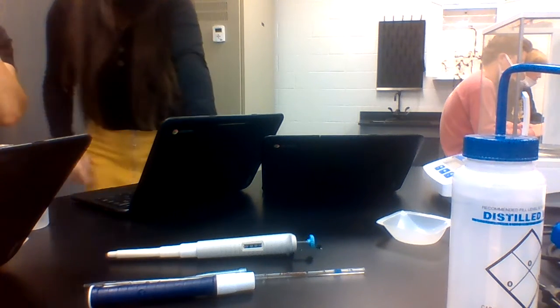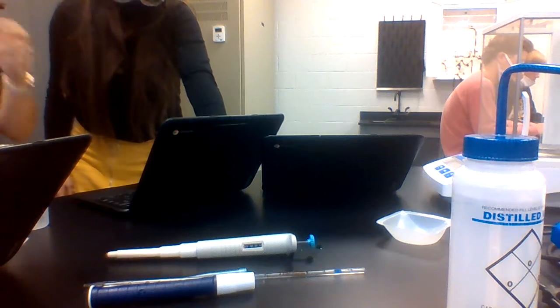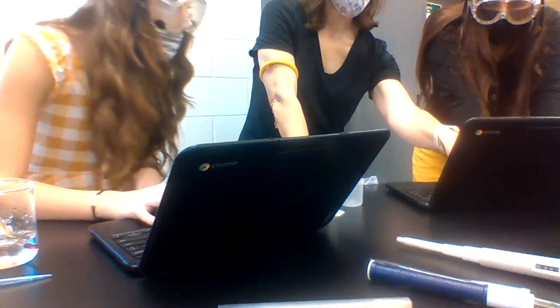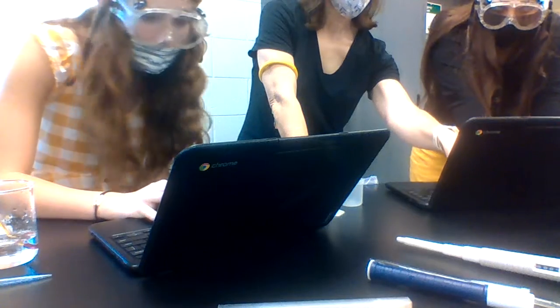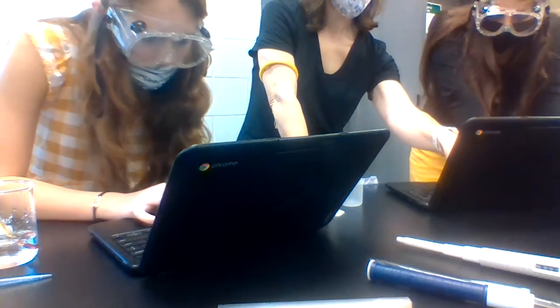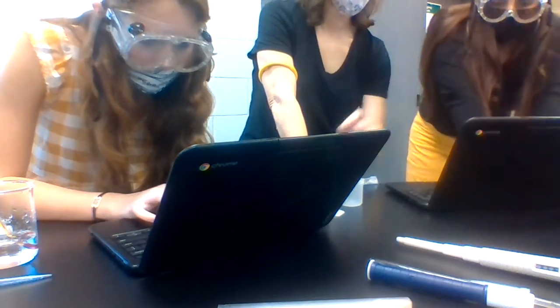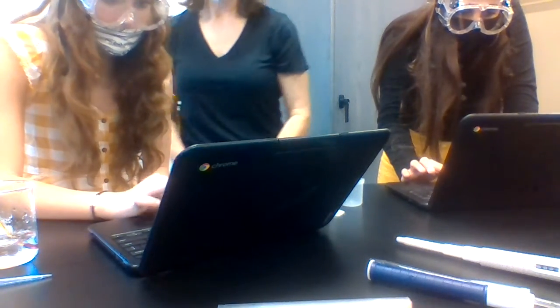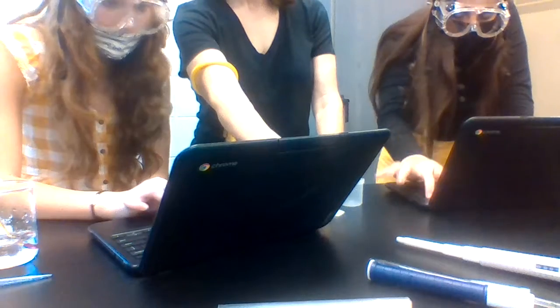So what is this part supposed to say? Okay, this is just going to be 1, 2, and 3. This is going to be 1.0, 2.0, 3.0. This one is going to be the same, 1.0, 2.0, 3.0. Down here, you have all three different. Where do we write the temperature of the water? I believe it's at the top, in that little space right there.